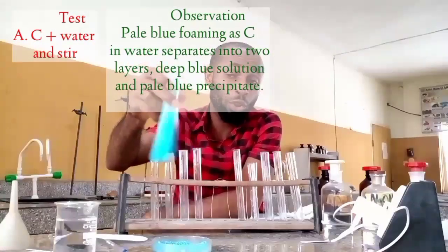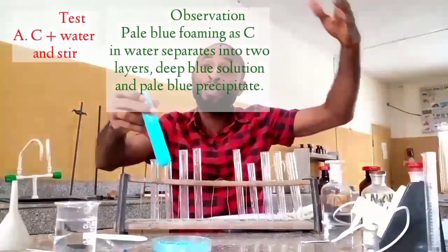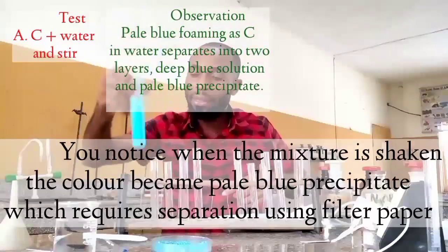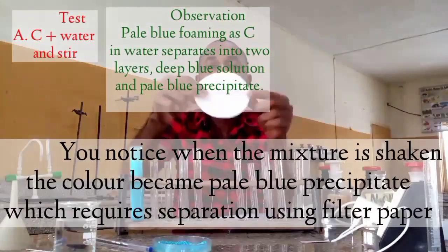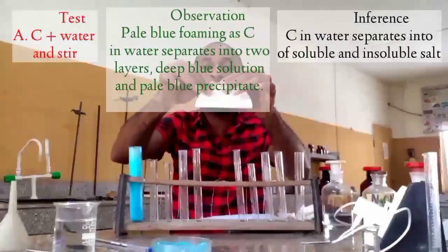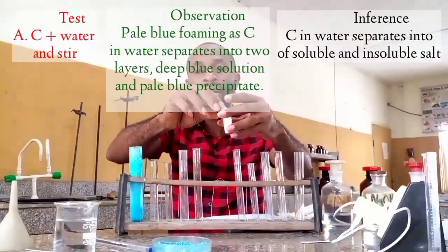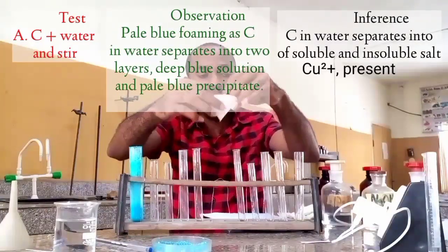According to the instruction they gave us, they asked us to filter. That means we are going to have a filtrate and also a residue. Now I'm going to use this to get my filtrate and the residue. This is a filter paper. I'll fold it like this. Fold it at 180 degrees, then fold it again at 90 degrees. Then I will look inside this place, the one that has a hole but covered, and pick one of it.